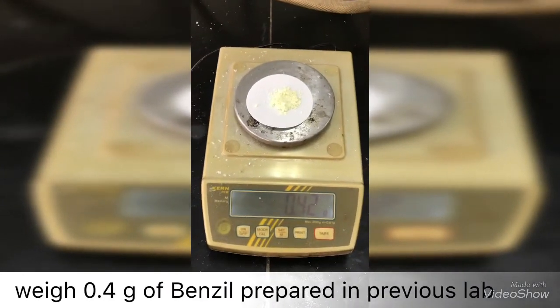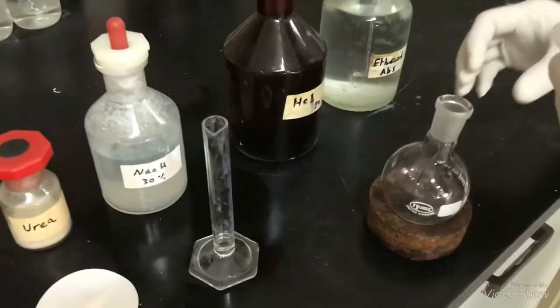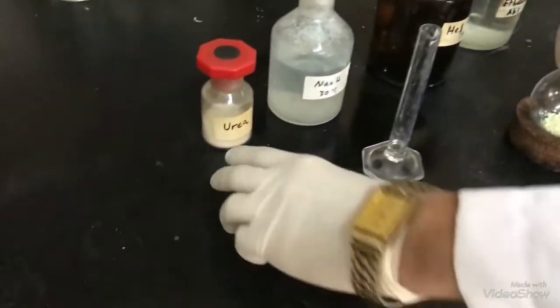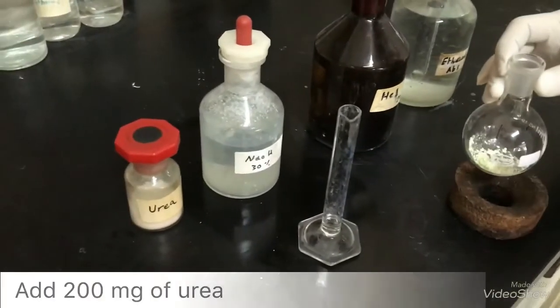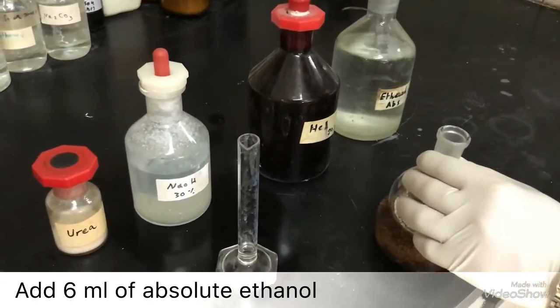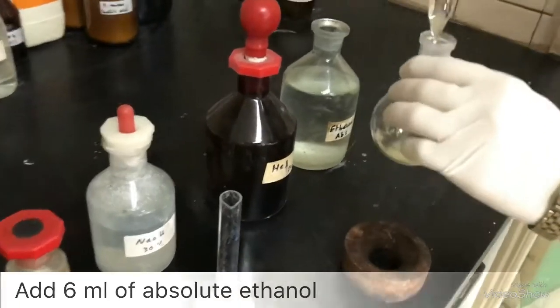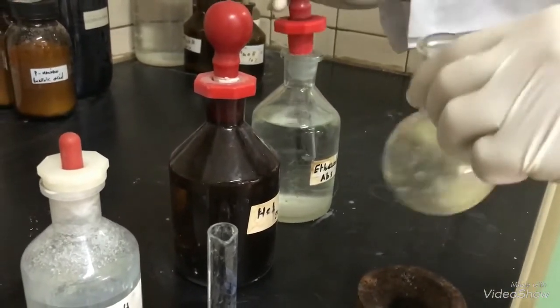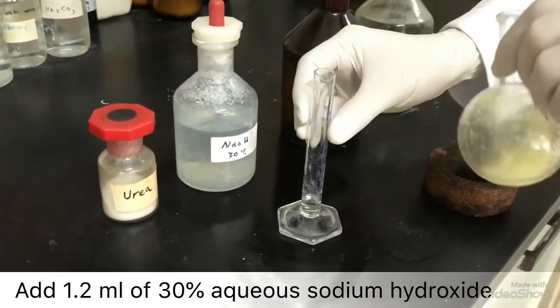Weigh 0.4 grams of the benzil compound you prepared in the last lab. In a round bottom flask, add 400 milligrams of the benzil compound, then 200 milligrams of urea, 6 ml of absolute ethanol, and finally 1.2 ml of 30% aqueous sodium hydroxide.